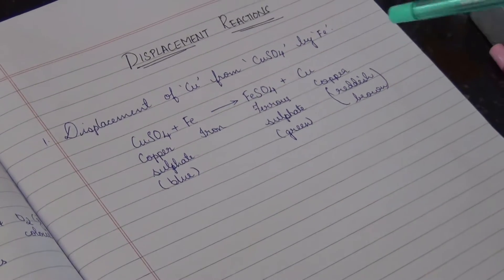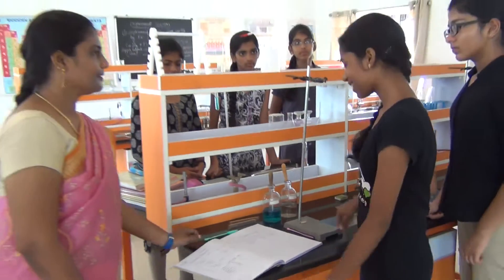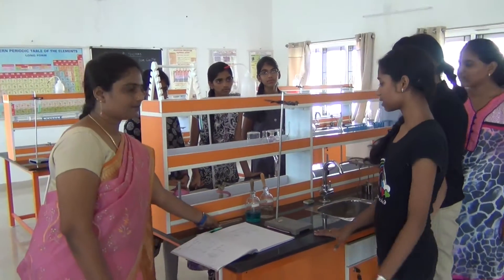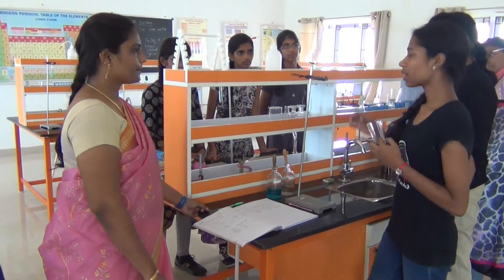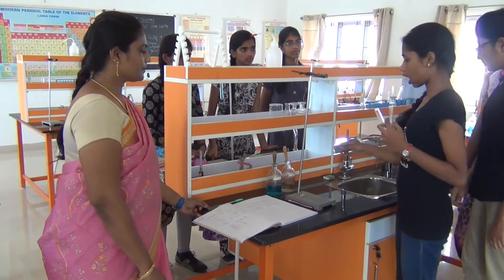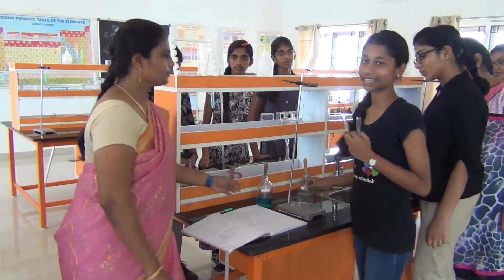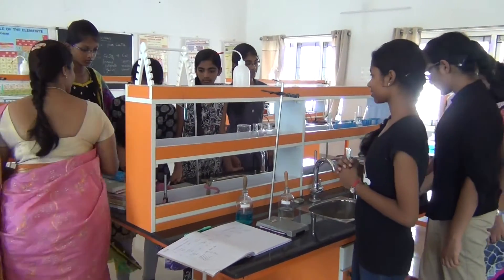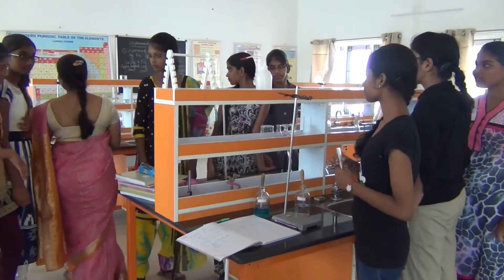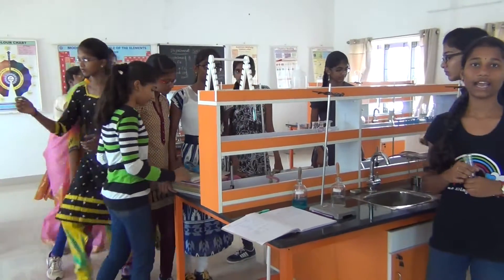The blue colour copper sulphate solution changes to green colour ferrous sulphate solution, and we can see a reddish brown deposit on the iron. The apparatus required for this: two test tubes, retort stand, copper sulphate solution, HCl, iron, and thread.